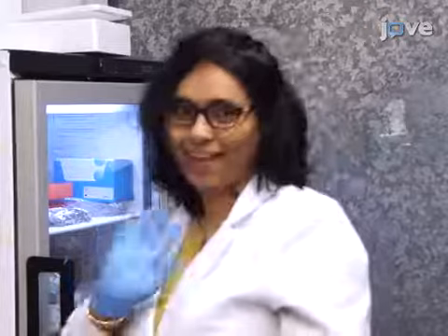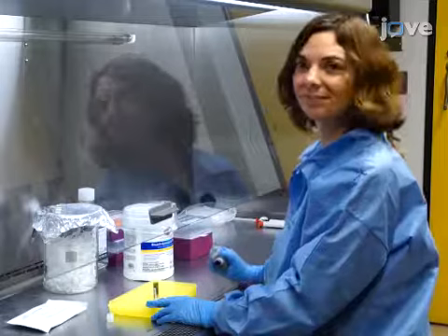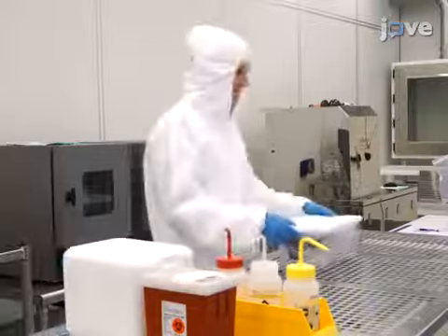Tesnova Rashid is a graduate student in the lab who does a lot of the day-to-day microbiology. Eugenie Bassir is a postdoc fellow who has taught Tesnova many of the skills and also assists in the lab.